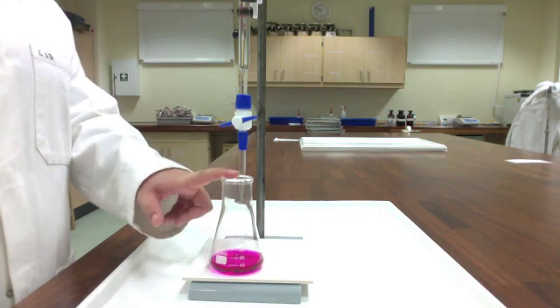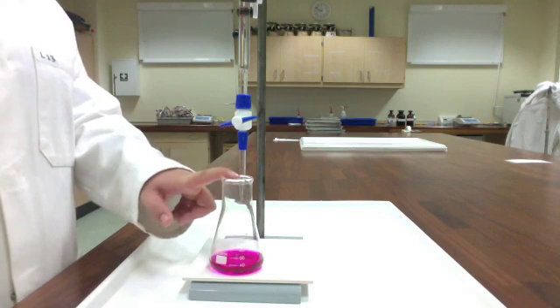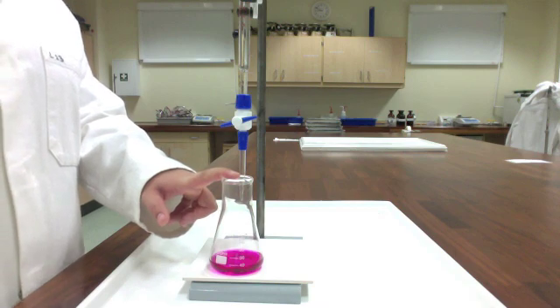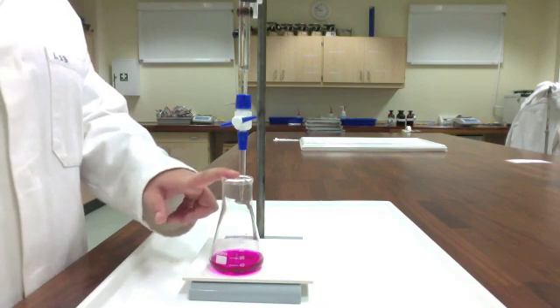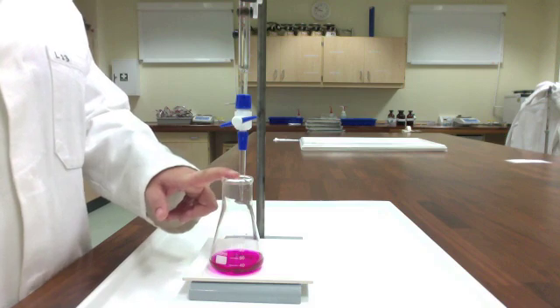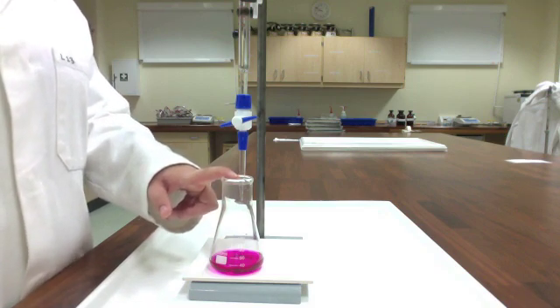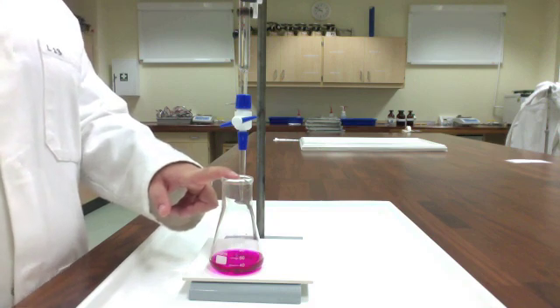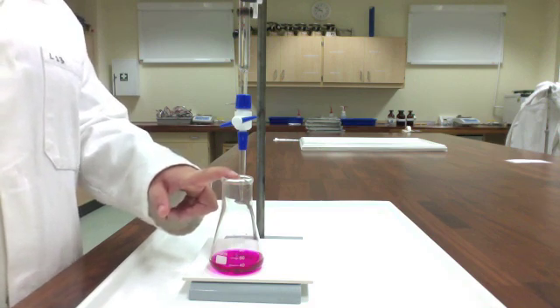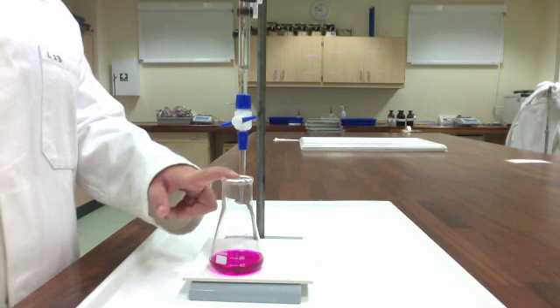How this is helpful is for my next three trials, what I'm going to do, and this will make things move faster, is I know I can add very quickly 9 milliliters, I would say, in this particular case. And then I know that for that last milliliter, milliliter and a half, I would guess, I need to go more slowly.